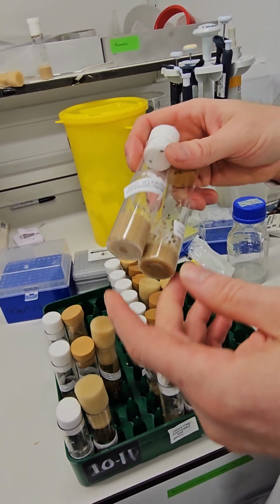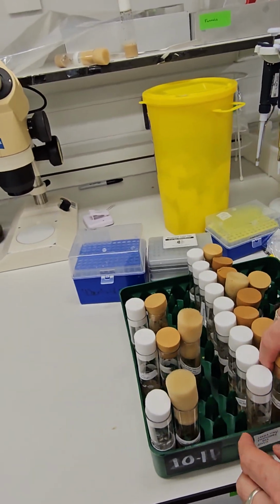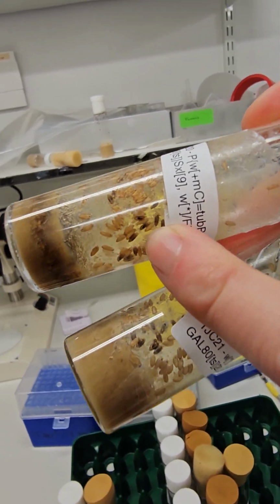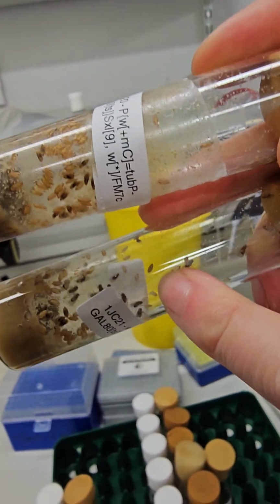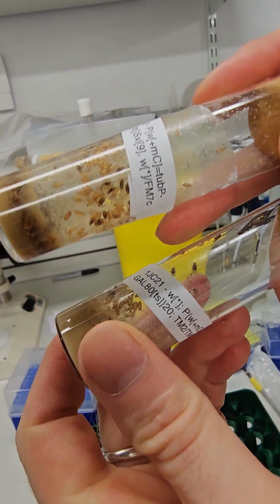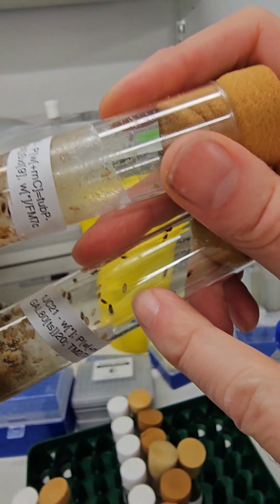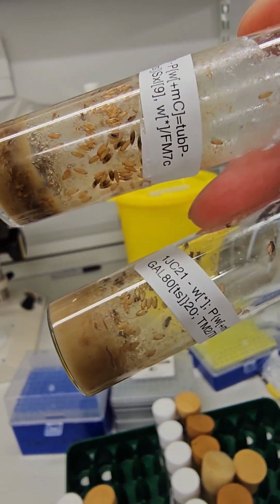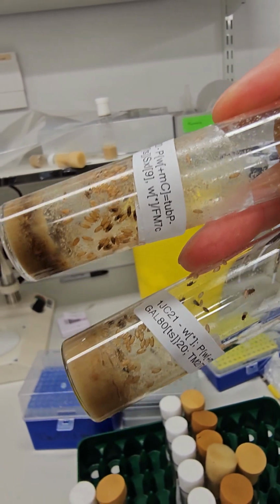And you can see some of these flies look different to one another. So, for example, the flies that we had coming out from here, if you look at the pupal cases, these pupal cases look like basmati. Yeah. These pupal cases look like arborio risotto rice. Yeah? So these flies, as well as having the piece of DNA that we've put inside them, also carry a slightly different chromosome that has what we call a phenotypic marker on it. It has a visual difference. Okay. So you can tell flies that have that particular chromosome with them.